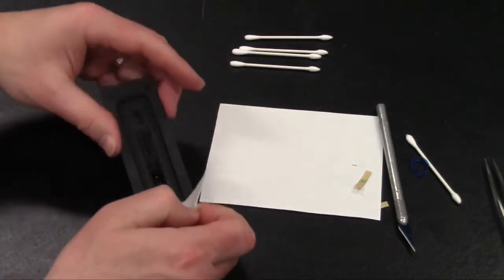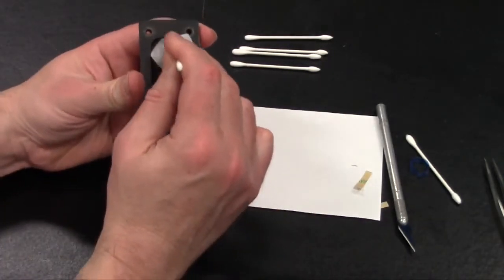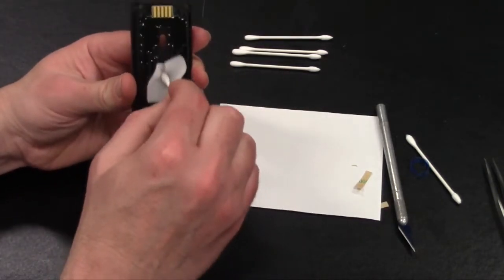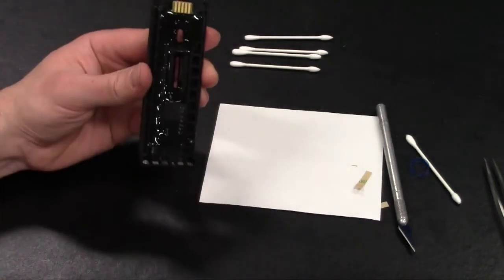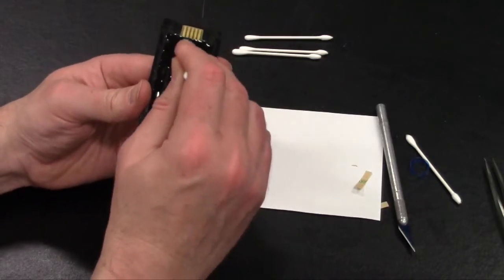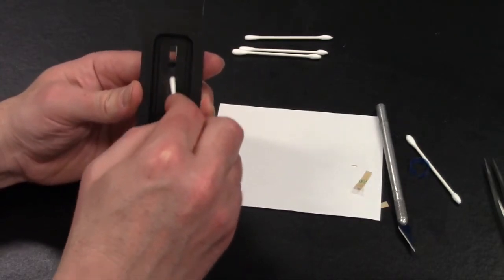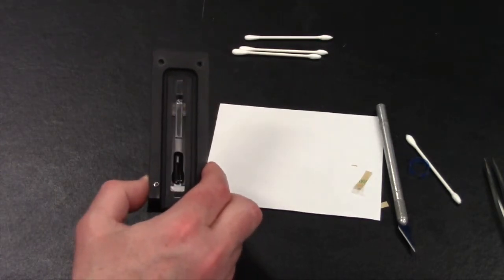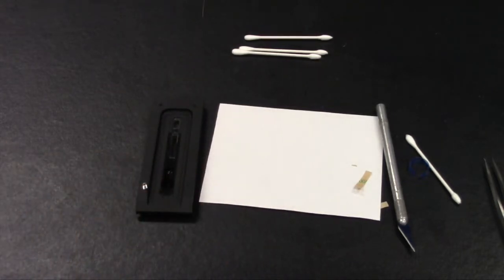And once you're done, again, you can use your swab to apply some pressure to clean the top and the bottom areas of that lens, making sure you clean both the top and the bottom window areas. Once done, take another swab that's dry and clean off any residue that was on the lens. When you're done, you should be able to hold the lens up to a light and look at it and make sure it's clean and there's no specks or dirt or contamination or any fingerprints. Once it's clean, then we can put the whole assembly back together.